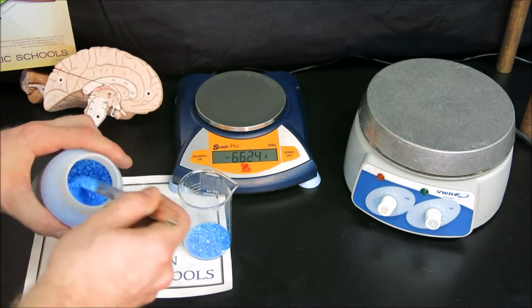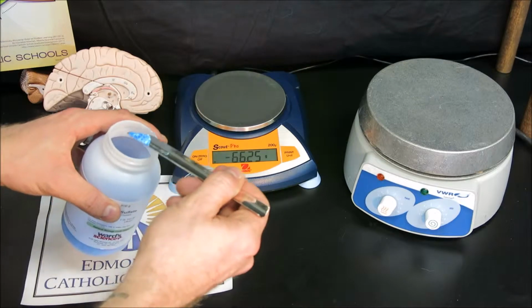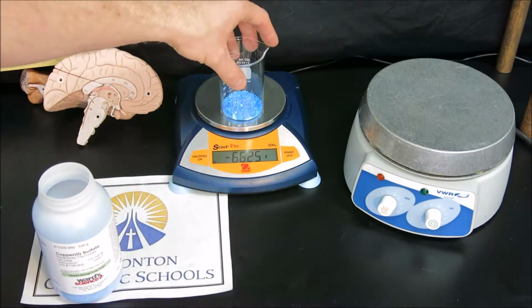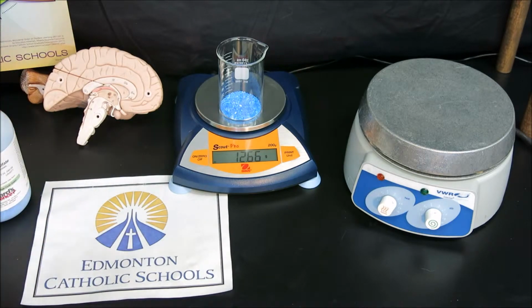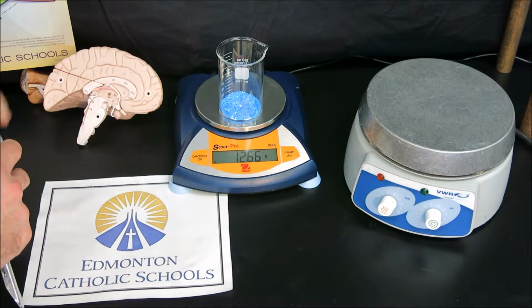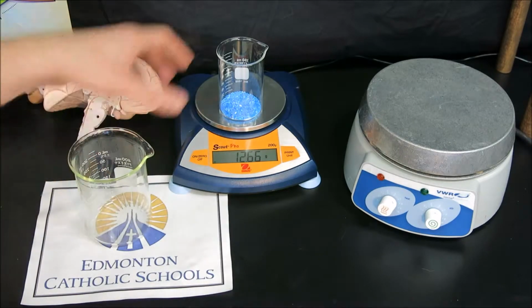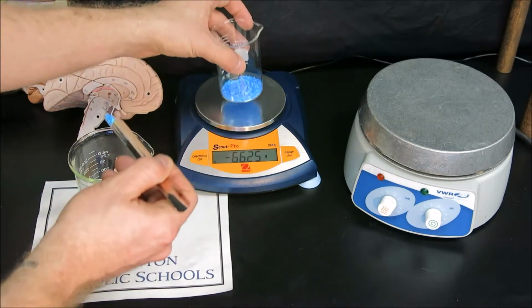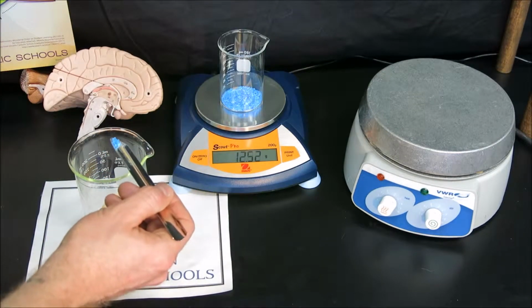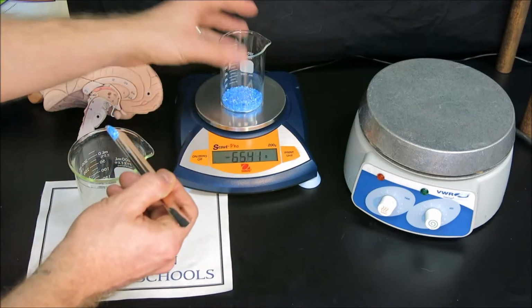And if we pass the 12 grams, we can remove some of the copper-2 sulfate and place it in a waste beaker. So for example, 12.66 grams, put my lid on my copper-2 sulfate, we can take this and place extra copper-2 sulfate into a waste beaker and bring it down to the required 12 grams of copper-2 sulfate.